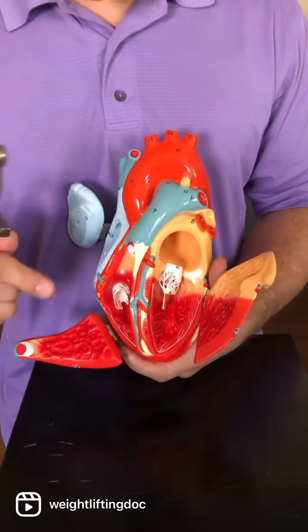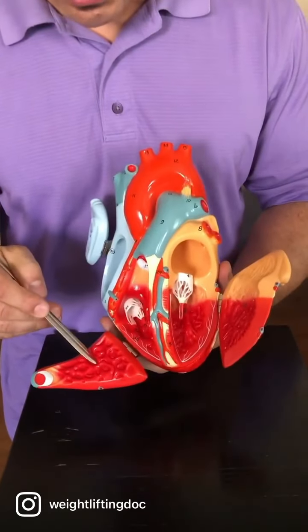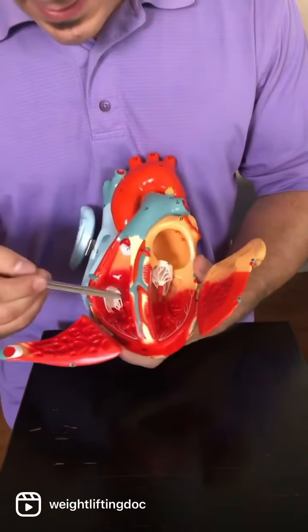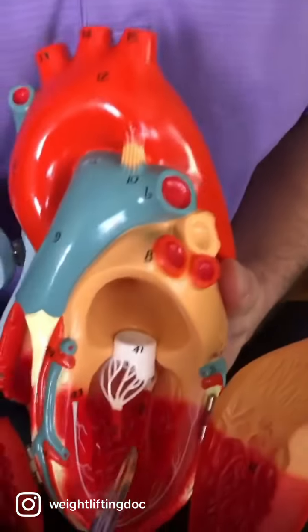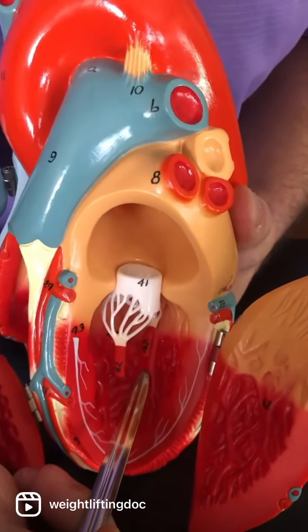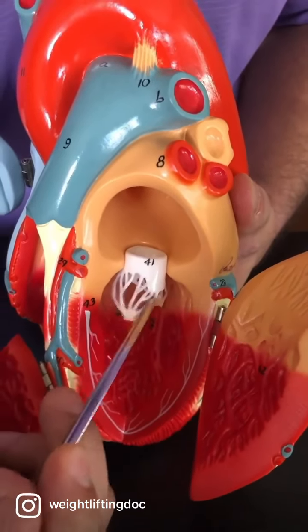Then we're going to have some muscles that are attached to the valves, and those are going to have a different name. So this is trabeculae carneae. Up here we have pectinate, right? And then inside the ventricles also, this muscle right here, that bump, is called a papillary muscle. Papillary muscles attach to these things here, which look like spiderweb or cord-like things.